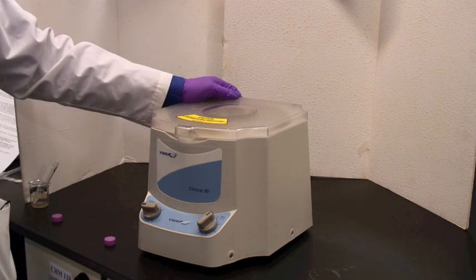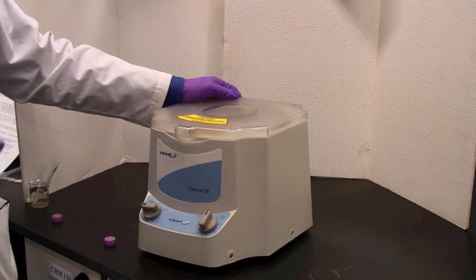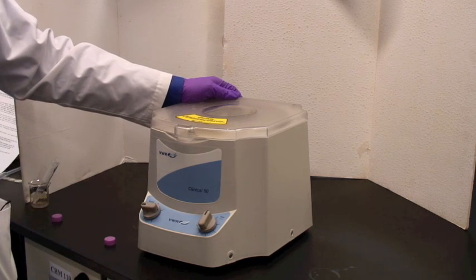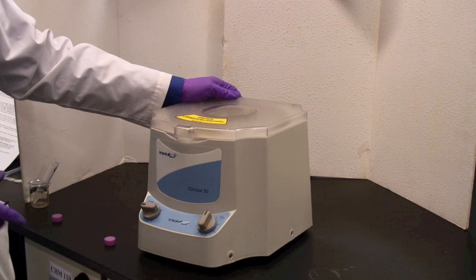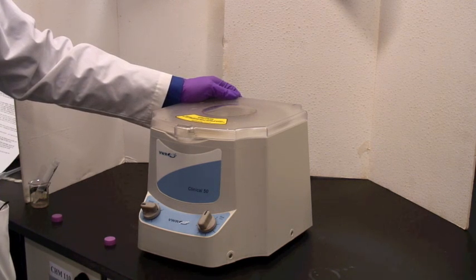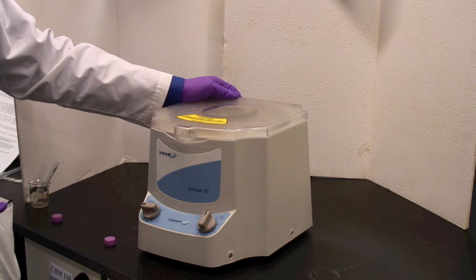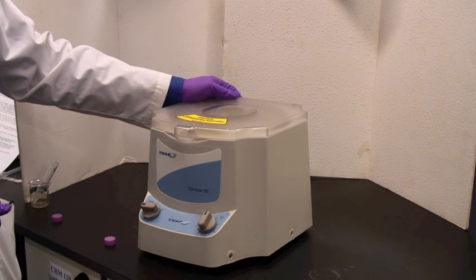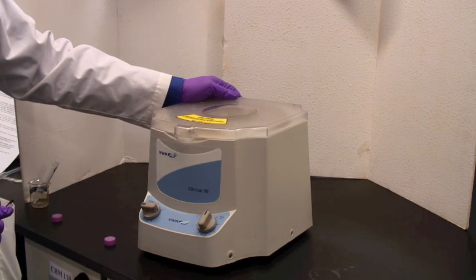The switch on the machine is actually clockwork. When you crank it up, you can set it for an appropriate amount of time. It's now been one minute. The switch has turned itself off, and it is spinning down in terms of speed. You need to wait until it's not whizzing around at high velocity before you open the lid.